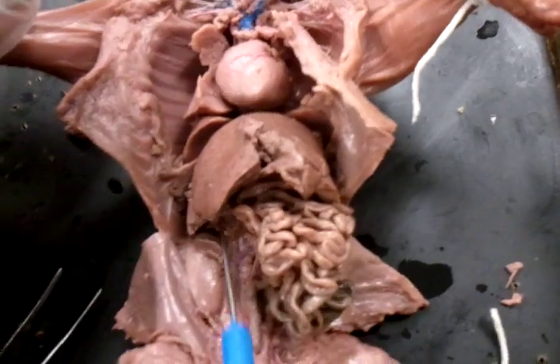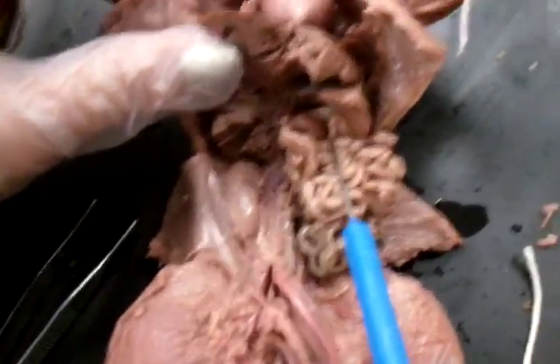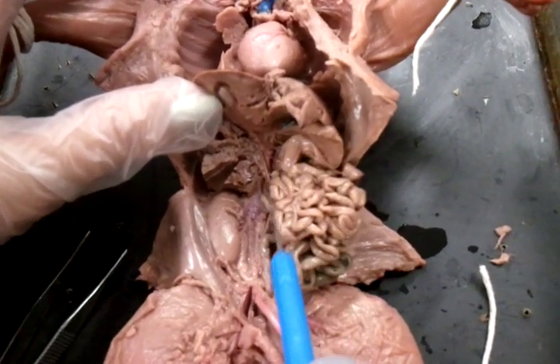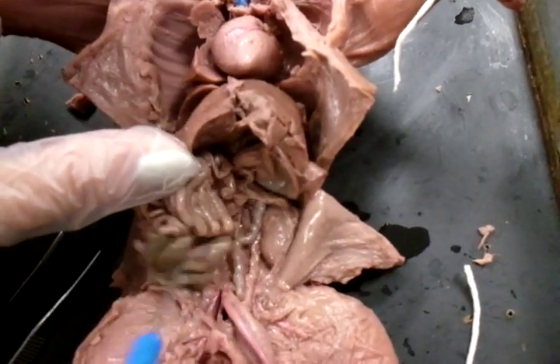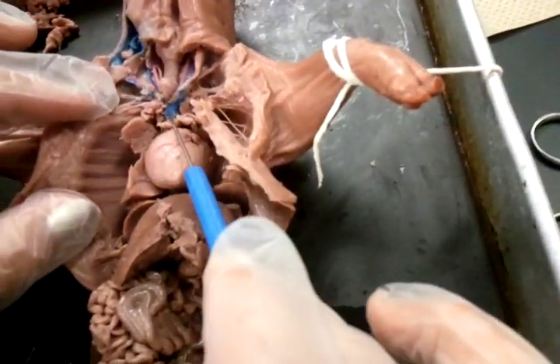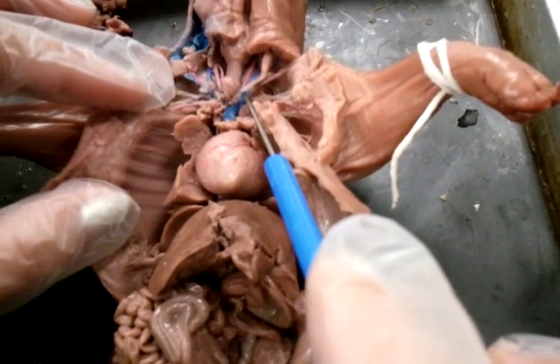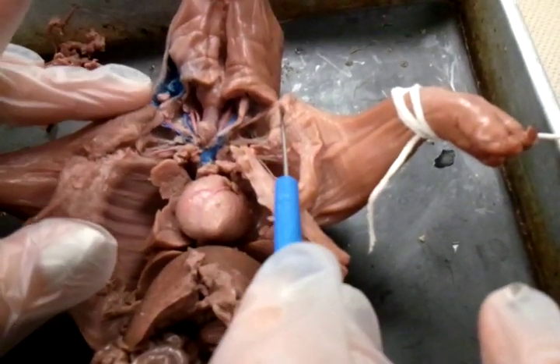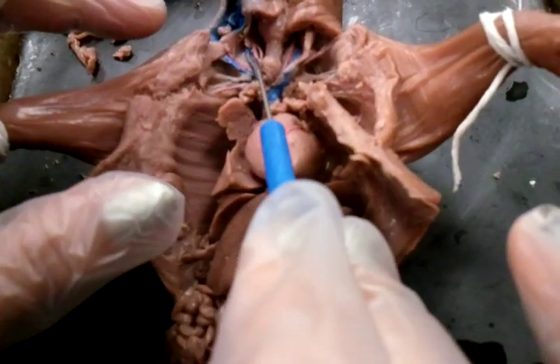I'm trying to think of what else we did over here. Some of it is... I know there's like an artery you have to know that connects like something. I don't know. I mean, that's for the most part, right? And then under is the brachial — brachial, subclavian something, under this, the trunk, under this. It goes into the arms, which is the artery and vein, brachial something. Artery and vein.